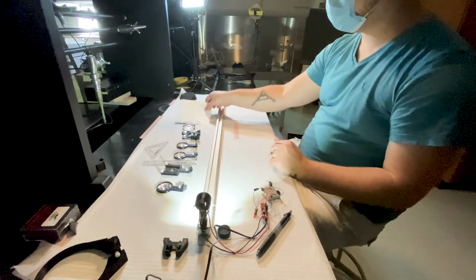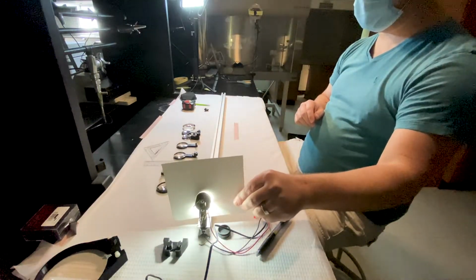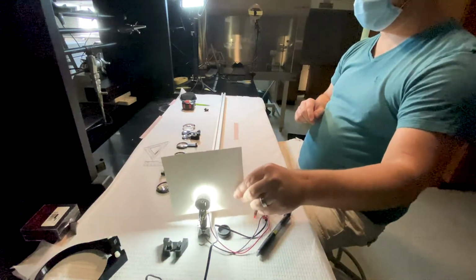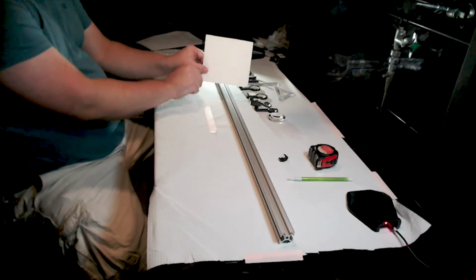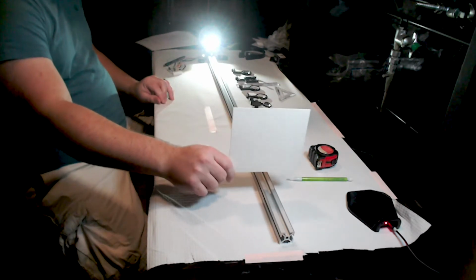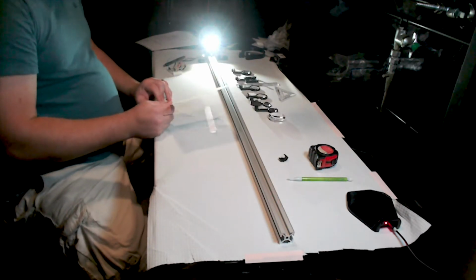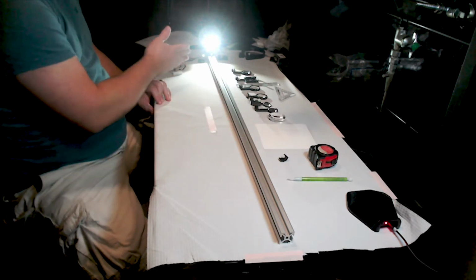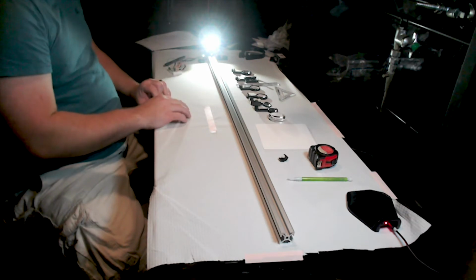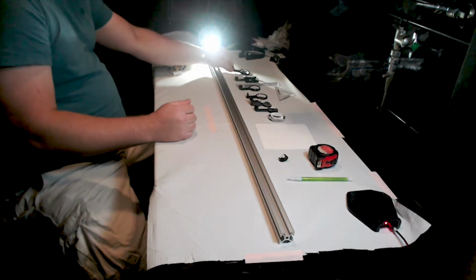Now what you'll notice is that my light source is not super even. Right? You can see that it obviously starts at that LED and then spreads out quite a bit. And we want nice, even illumination. So we're not going to be building a Köhler microscope today, but we will try to make this a little bit more even than it is just coming out as it's diverging.